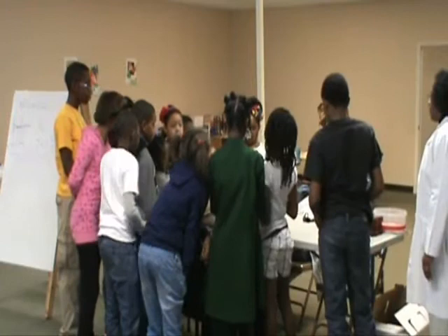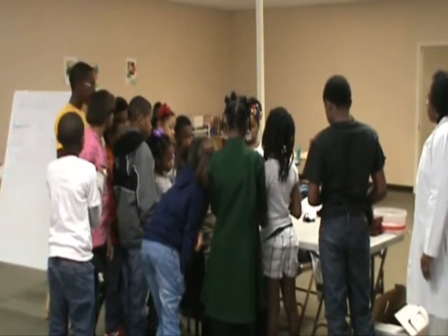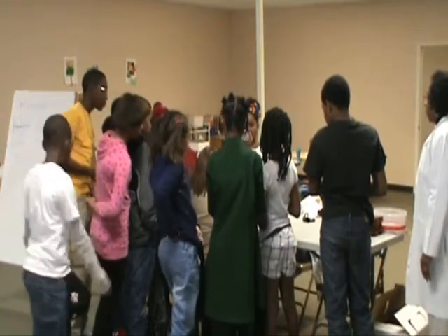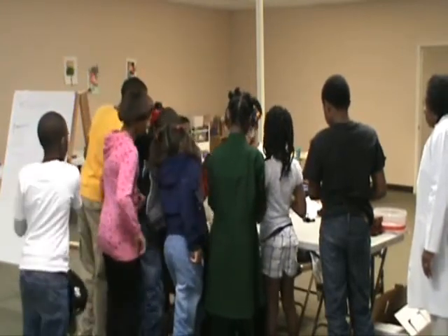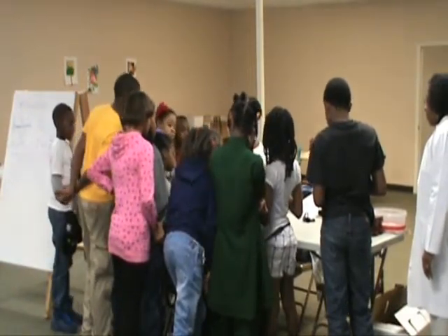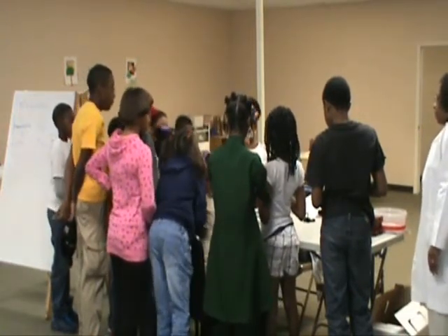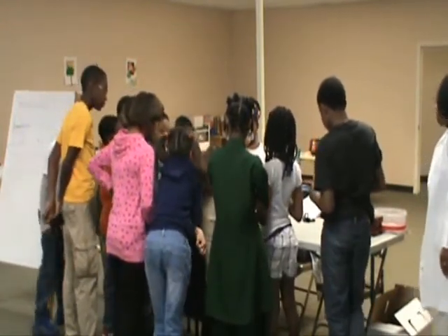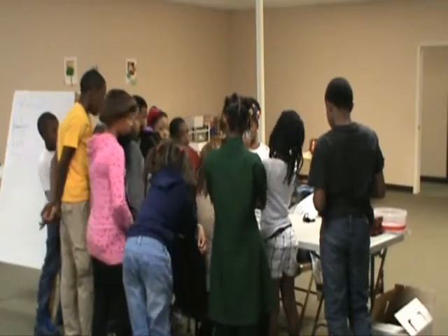So what do y'all think? Now I want you to see what we would record, because we have numbers now. This is 30 grams, and this is 1, but each of those are tenths, like a dime. 10 dimes make a dollar. So that's 1 tenth, 2 tenths, 3 tenths. This is 31.3 grams. Got it? All right, let's go to the next one.